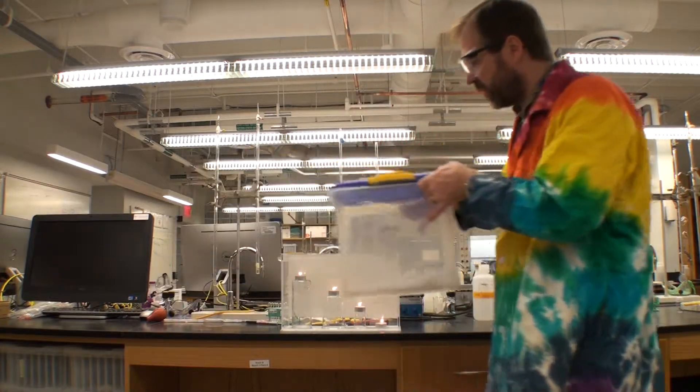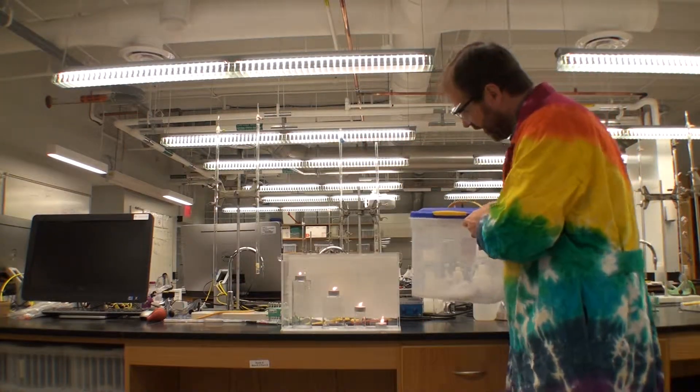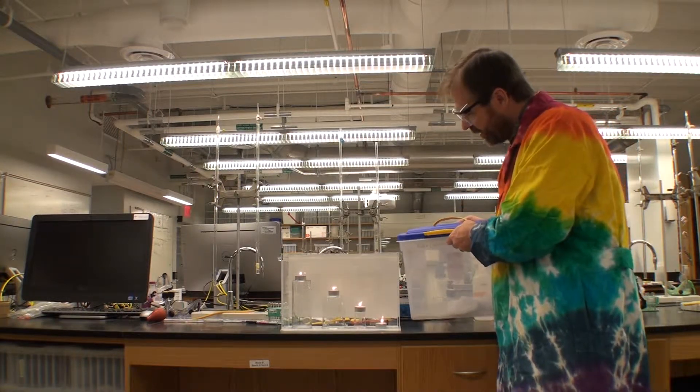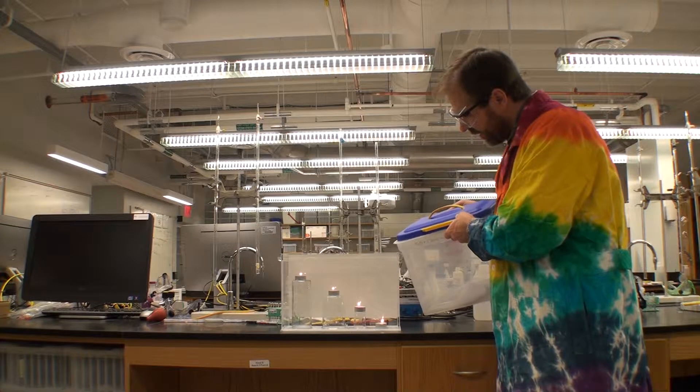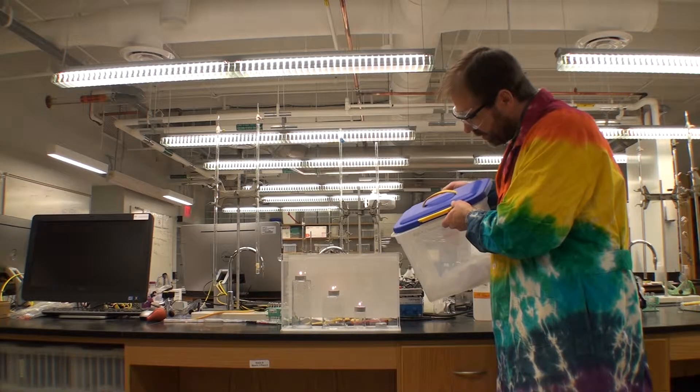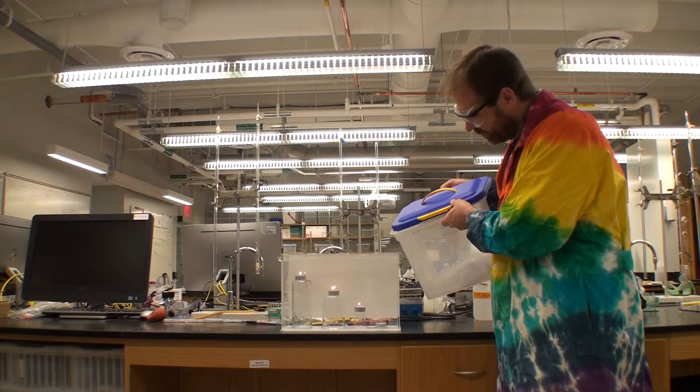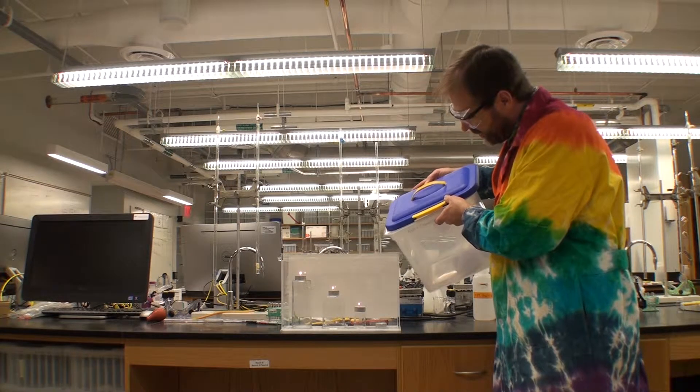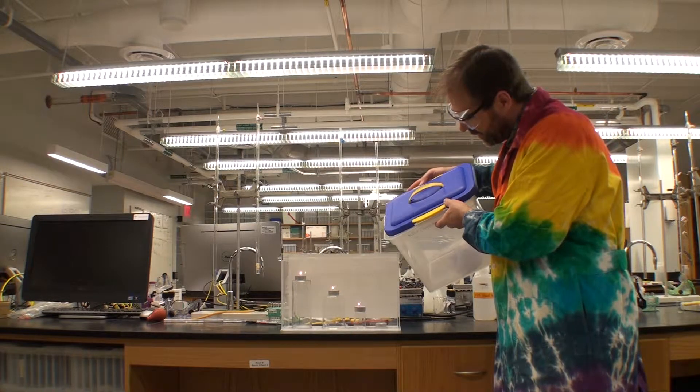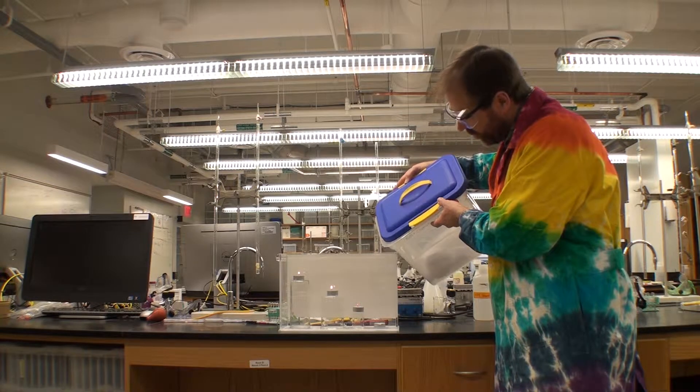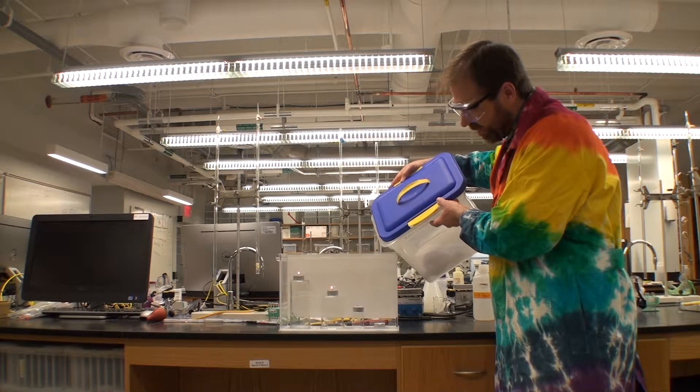I'm going to take my carbon dioxide, and if you look carefully—I'll do this again zoomed in very close—but it doesn't look like I'm doing much of anything. But I can pour. Oh, there went one candle. And as it fills up, we should hopefully start to see the other candles start to go out. It's been a little slow today. All right, there's the next one.